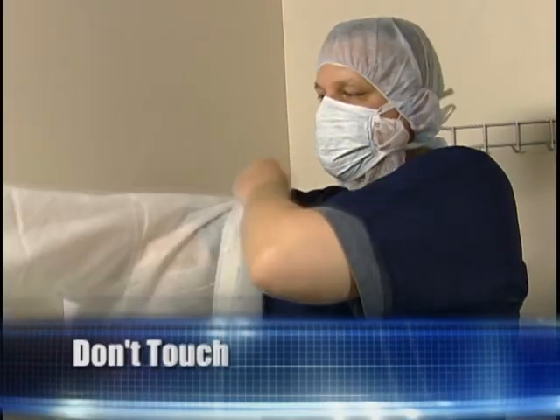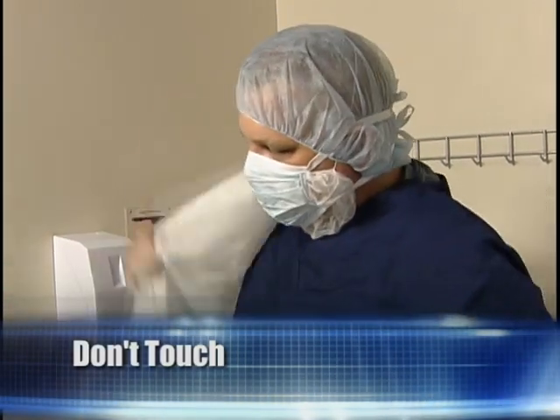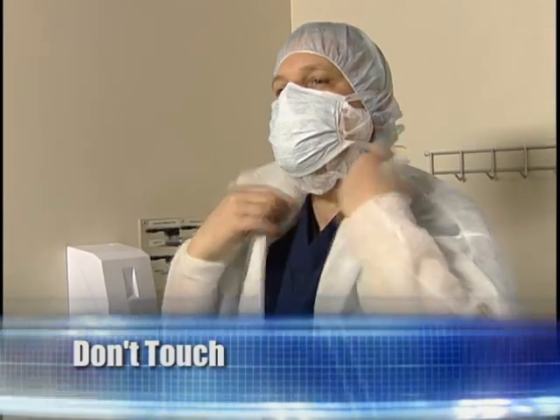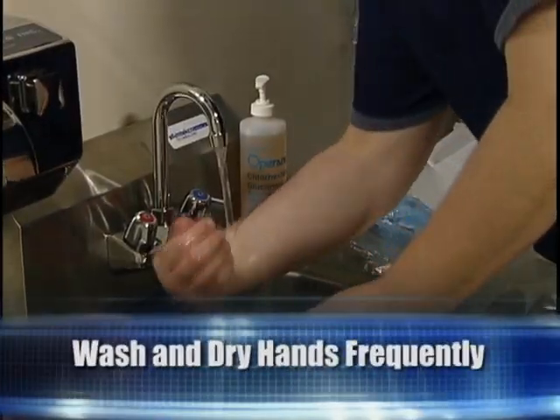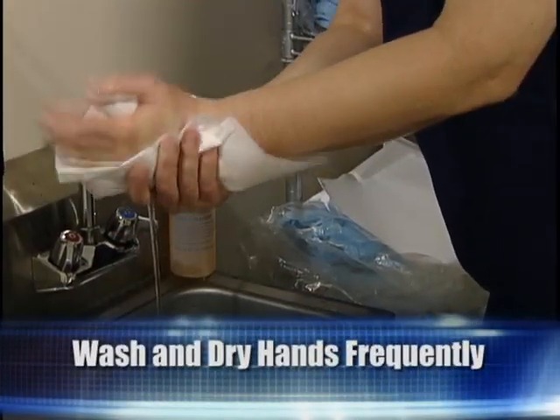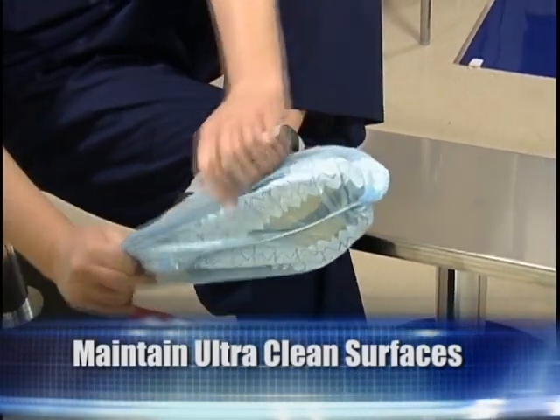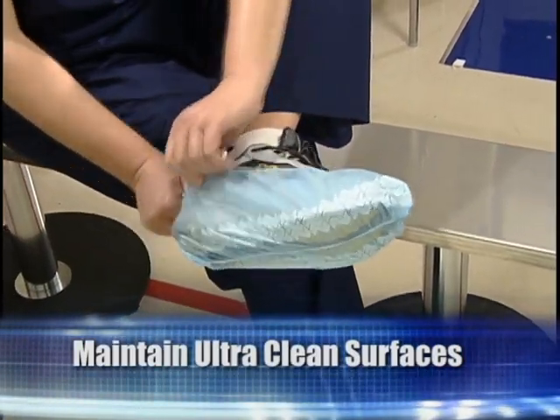There are a variety of possible layouts for the gowning area. Regardless of the design, all pharmacy staff should adhere to the following guidelines for proper gowning. Don't touch. Most cleanliness violations occur when dirty hands touch a garment or when it touches a dirty floor. Wash and dry hands frequently. Maintain ultra-clean, unviolated surfaces where garments can be donned without contamination.